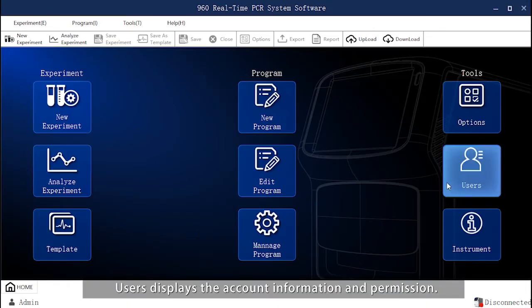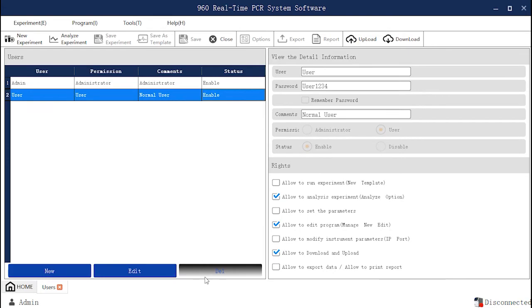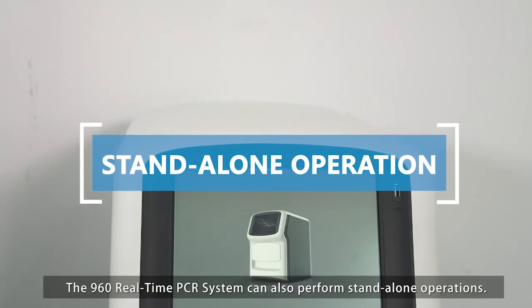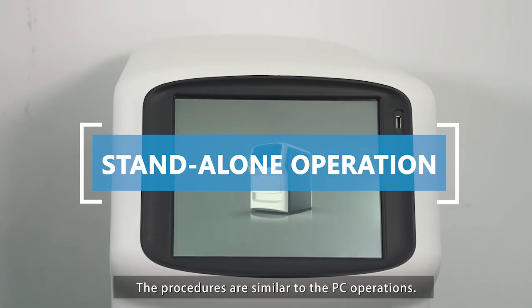Users. Users displays the account information and permission. Create, edit, and delete users from this page. Standalone operation. The 960 real-time PCR system can also perform standalone operations. The procedures are similar to the PC operations.